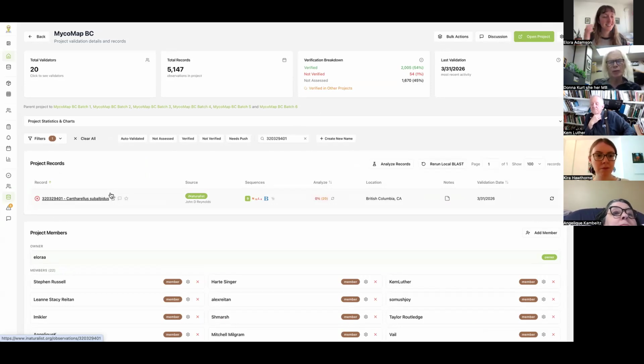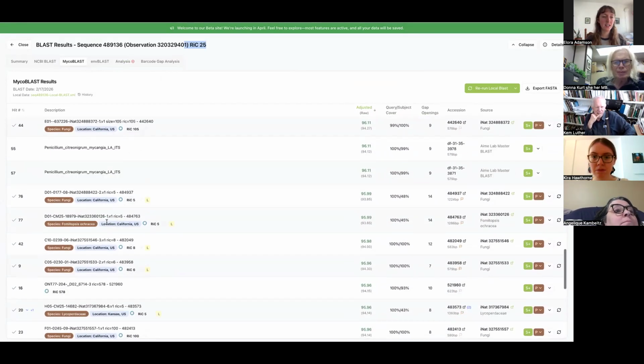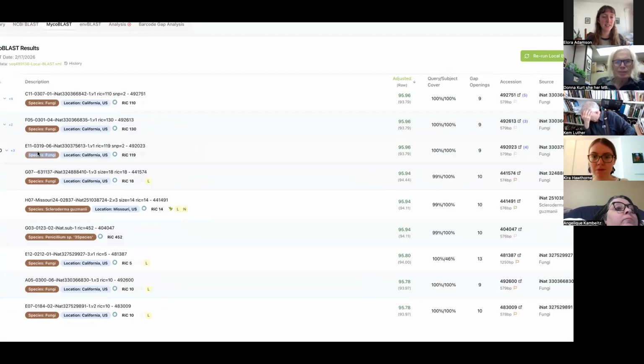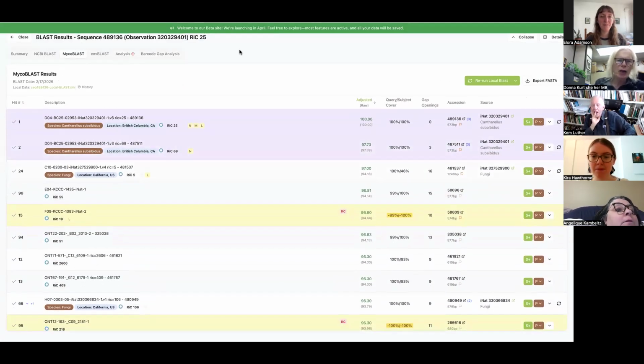No, but the one thing I was noticing is each of those blasts, it showed itself and matching itself all the way through. Yeah, it'll match itself every time, but itself in this case is not the chanterelle, it's the contaminant that came with the chanterelle somehow. Okay. So this is just classic contaminant blast results, especially when you start seeing fungi and stuff like this. That's sort of what I figured. But I like chanterelle, so I didn't want to mess it up. Totally.